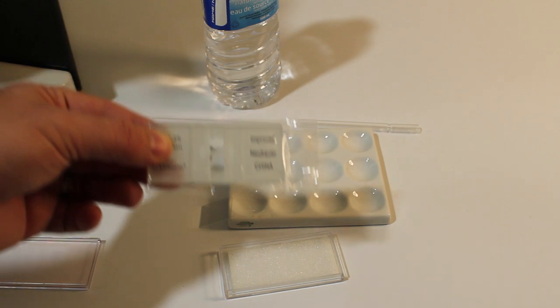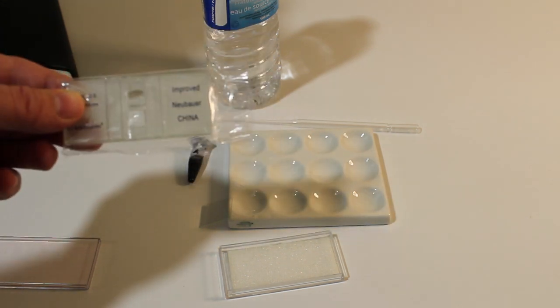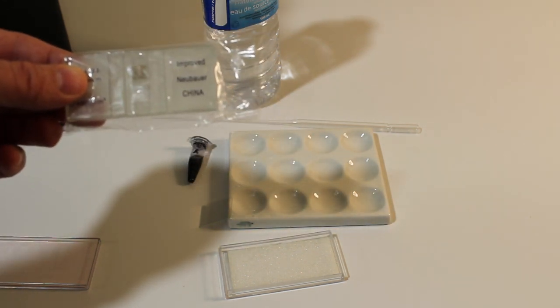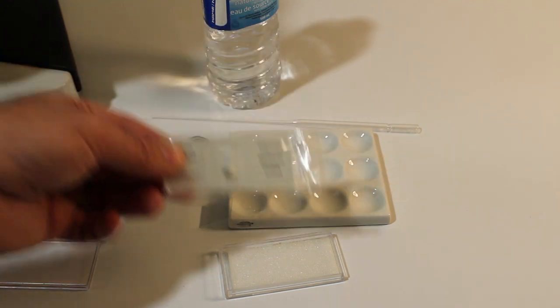If you don't have a plastic bag like this or a proper case I would recommend wrapping this up in a lint-free cloth, cotton or linen preferred, and then storing it someplace safe.